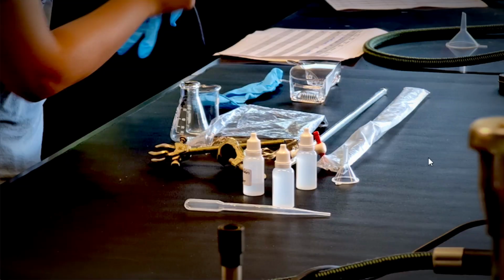For this lab, you're going to have your acid and base solution as well as an indicator. You're also going to have some sort of pipette in order to add your solutions to the beaker. You should have a beaker and a flask, and you always have your goggles and your gloves for your protection. You're going to have a metal stand, its base, as well as a burette, and some sort of connector to connect your metal stand to the burette. Some of you have this type of traditional metal connector, but some of you have 3D printed plastic connectors that should be even easier to connect to your burette.